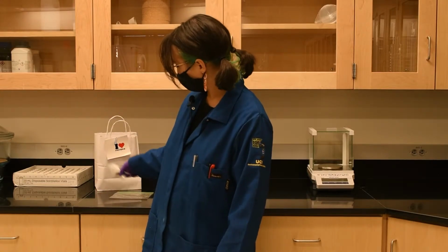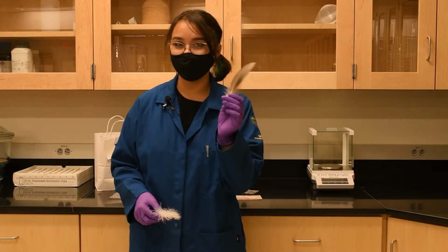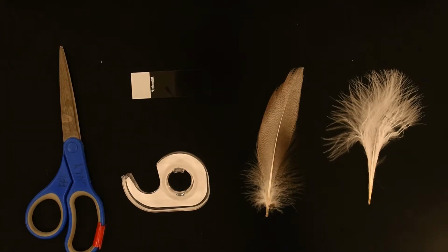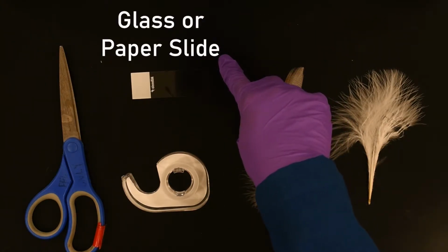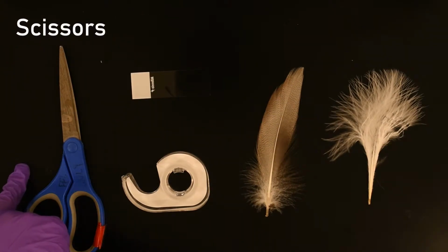We've included a set of two feathers in your kit to take a closer look at. A down feather and a contour feather. Let's go to the Foldscope and inspect the properties of these feathers. To prepare your feather slide, you will need your down feather, your contour feather, a glass slide or paper slide, clear tape, and a pair of scissors to cut your feathers.